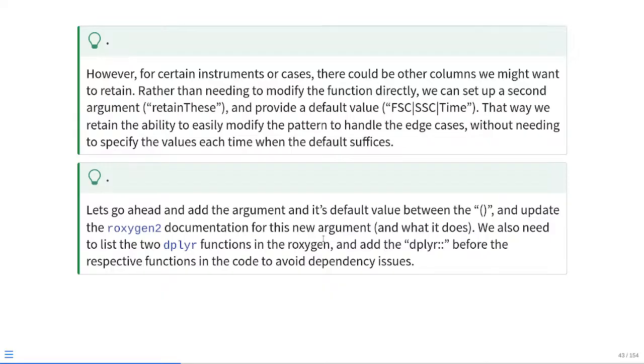To do this, let's go ahead and update our argument. We're adding in the second argument, which will be within the little parentheses, and then we'll just need to update the Roxygen2 documentation for the new argument, as well as tell us what it does. And then at that point, since we'll be adding a couple of dplyr dependencies in the form of select and matches, we need to update them in the Roxygen, as well as internally with the dplyr double colon, just so that they're able to avoid any dependency issues in case the package has not actually been libraried to our local environment when we run the function.